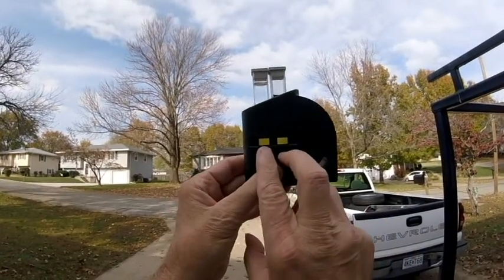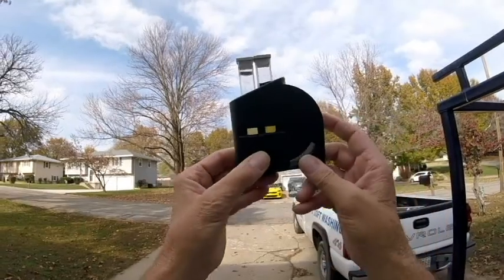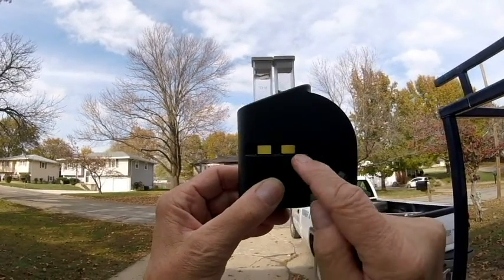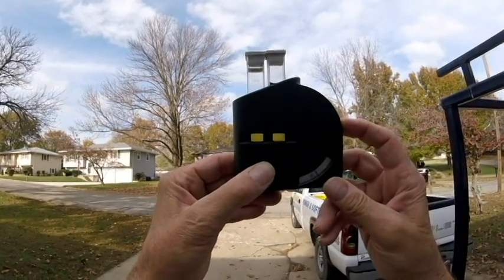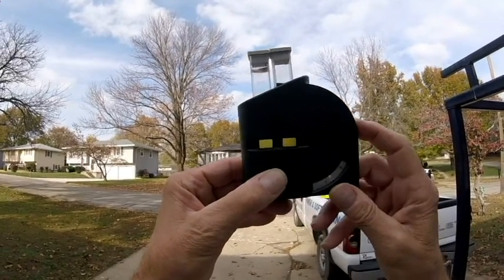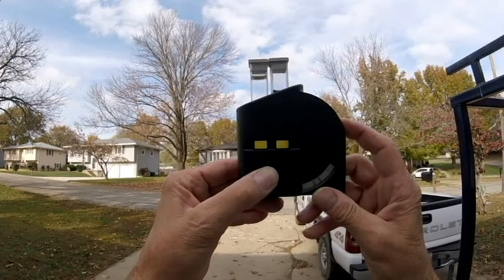Now we're going to closely match those two colors. I'll go to the extreme first — you see how the two colors are dark and light. We'll just keep rotating until we think the two color tints are the same. Once you go past, this side will get darker, and if you come back really far this side gets lighter. So kind of just work your way back and forth until you find a happy medium.